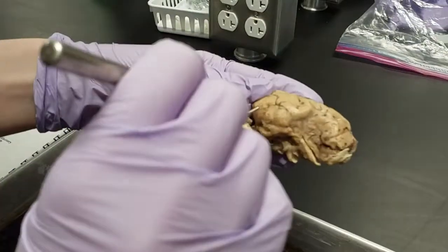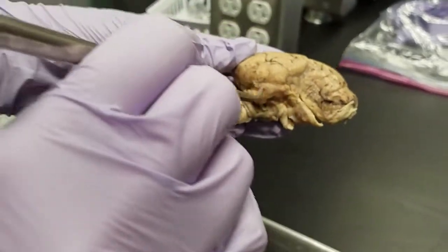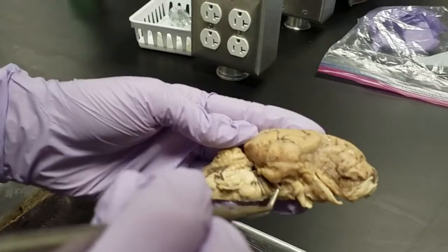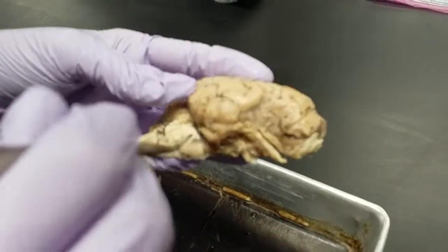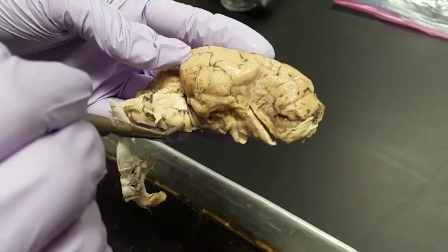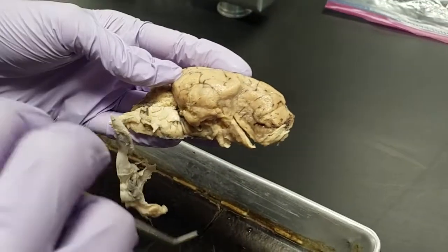this? So we also have the parahippocampal cortex, which is seen right below the temporal lobe. And where is it again? It's right below the temporal lobe. And then the cerebral peduncle, which are, I guess, right here. So since the cerebral peduncles are in the midbrain, that's what's shown in the diagram. Okay. So that's the lateral view.